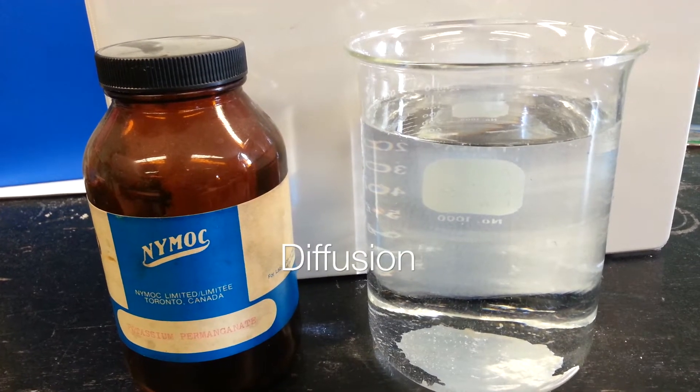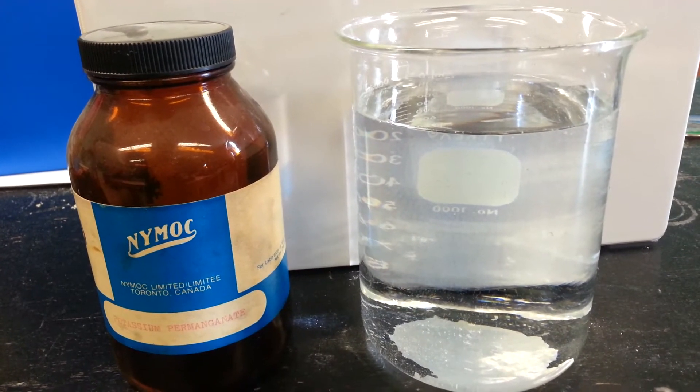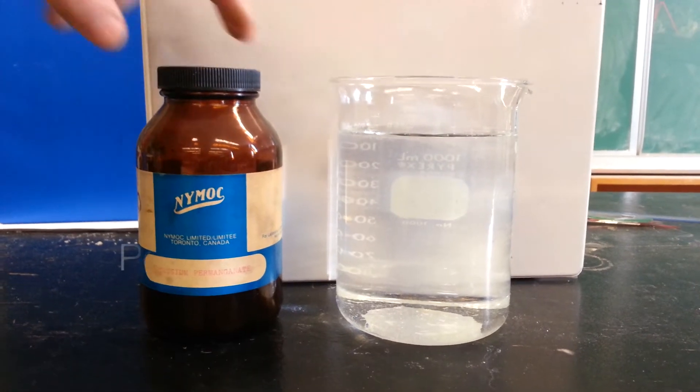This is experiment number 38. We'll be taking potassium permanganate and placing it into a beaker of water.